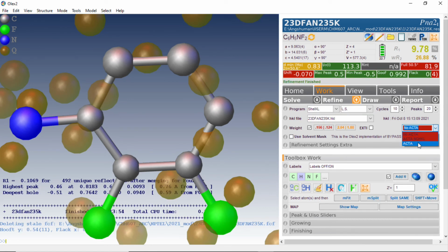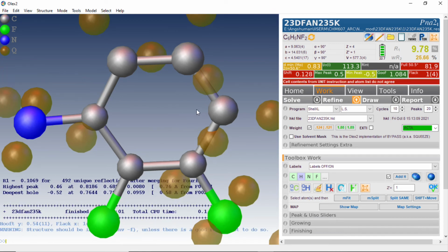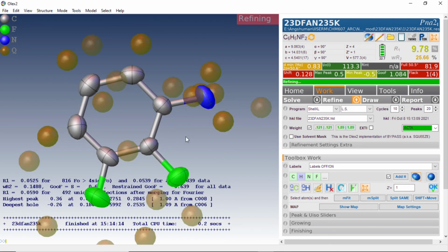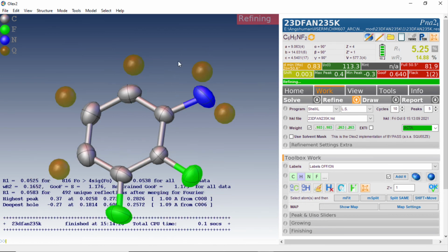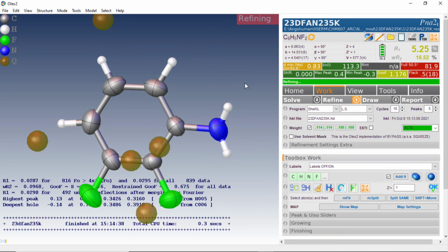We also activate the weight here, otherwise we may forget at the end. So what we have is the crystal structure of difluoroaniline, isotropic refinement, and then I am doing anisotropic. You see now the hydrogens are appearing. If I make it 5, you will see that just the hydrogen atoms that are connected to these carbons and nitrogen are appearing. One can easily identify those and set as hydrogens and refine.